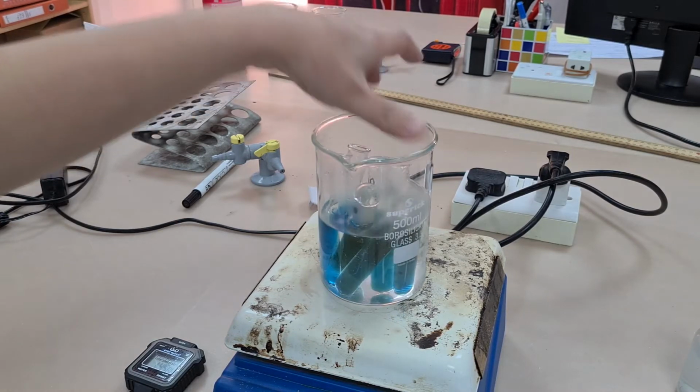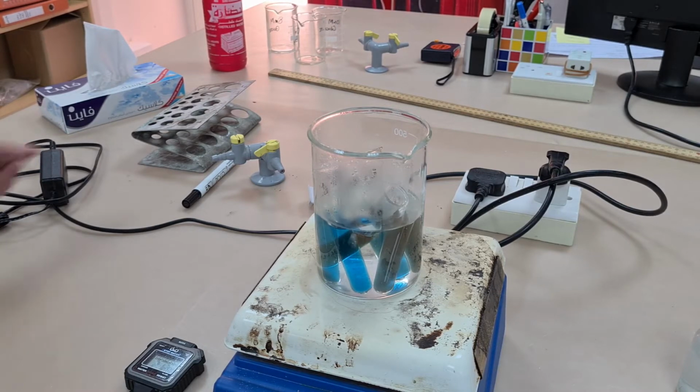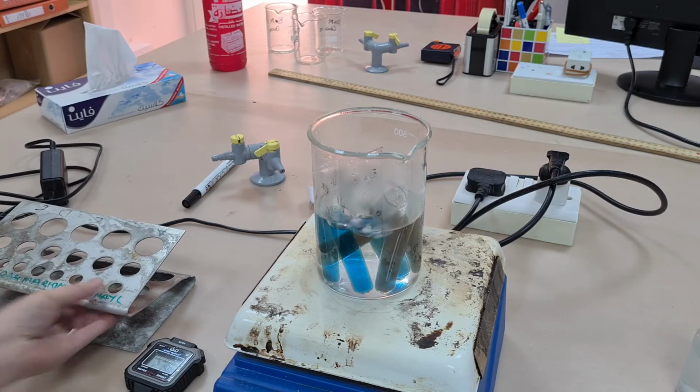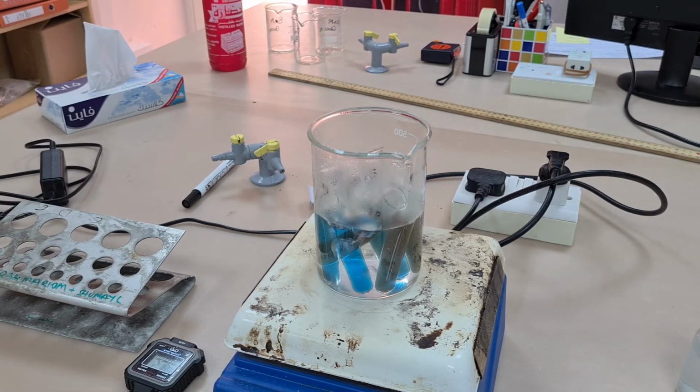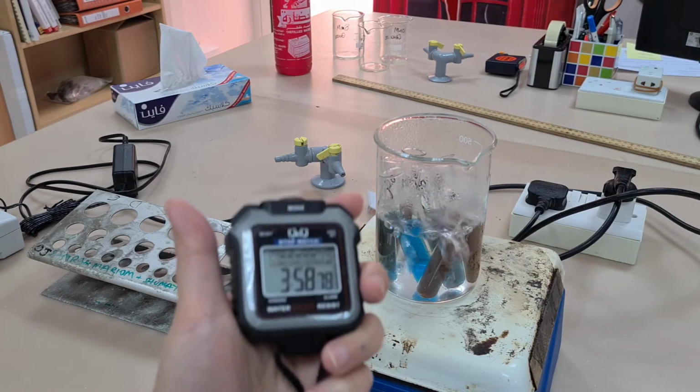Benedict's reagent is highly sensitive. It will detect the smallest concentrations of a reducing sugar. For that reason, I have made a 0.01 molar solution of glucose. From that, I have made a dilution series of 20, 40, 60, 80 and 100%. So if glucose has a molecular mass of 180 grams and I want to make a 0.01 molar solution, how many grams of glucose will I add to my 1 decimeter cubed of water? I'll give you the answer at the end.